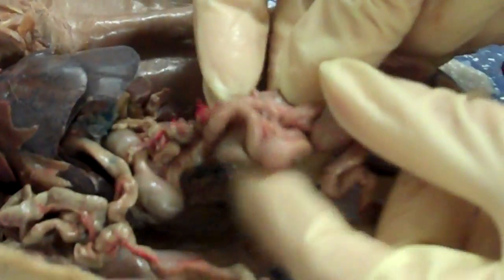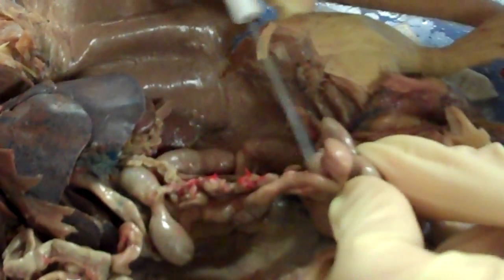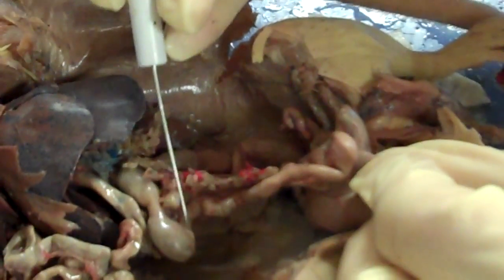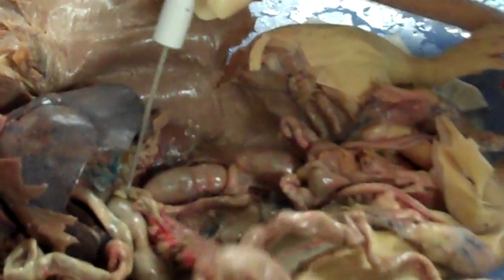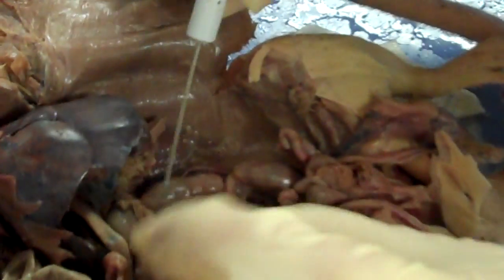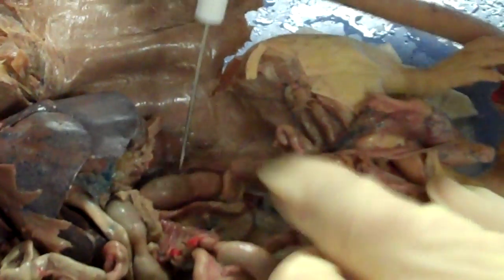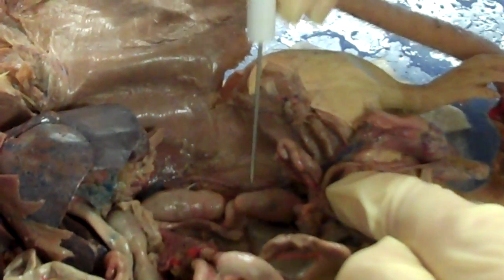From the cecum, you find the beginning of the colon. This is the ascending colon going up, the transverse colon going across, and the descending colon going down. These masses inside the colon are feces.